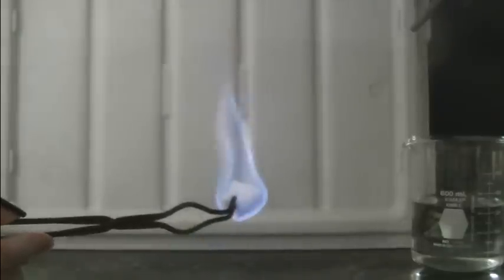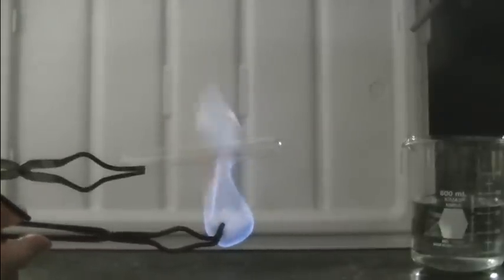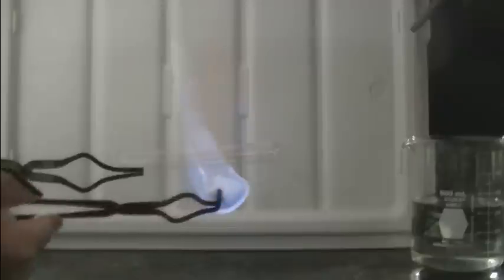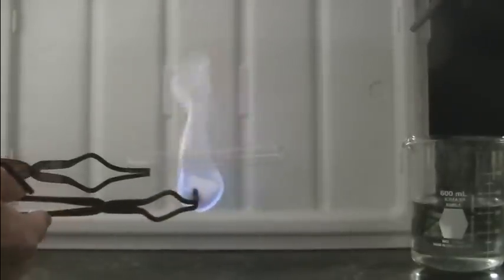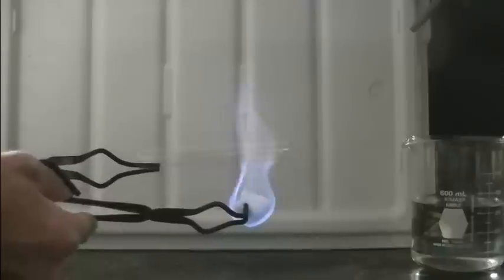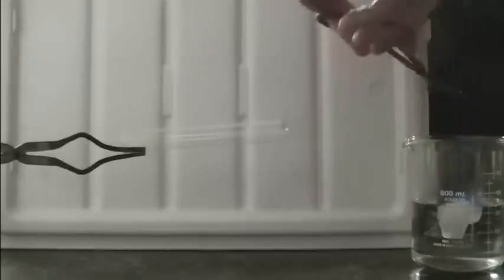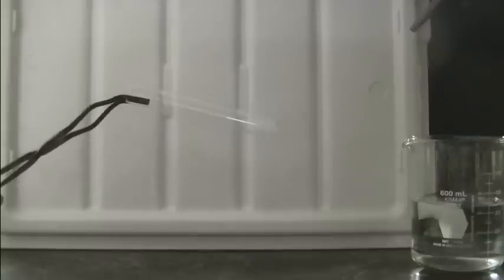Now to sort of show that no soot's being formed I can take a clean test tube and place it in the flame. Now run that back and forth. I can actually see some condensation of product water on the test tube originally. Now it's sort of burnt off. Sometimes I can blow that out but often times we have to just stick it in a beaker of water. But if you look at the test tube you will not see any soot. That's evidence of complete combustion.